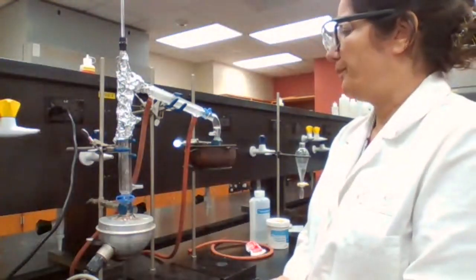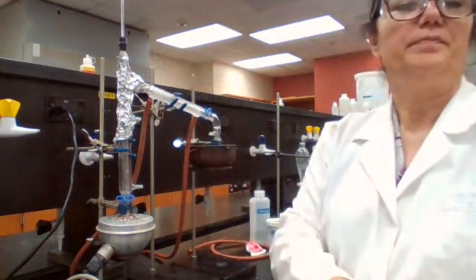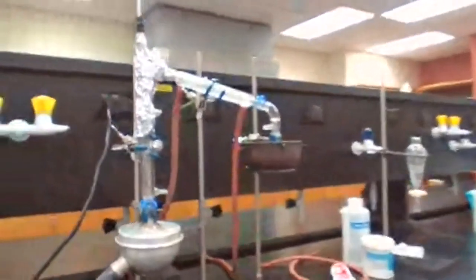Okay. Did you take a screenshot of the setup after aluminum? If not, you need to take it now.